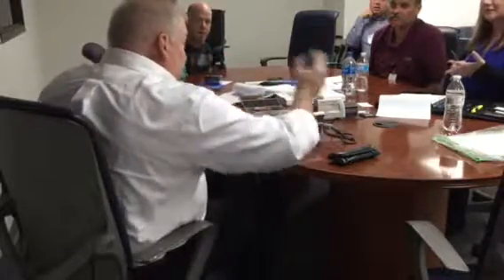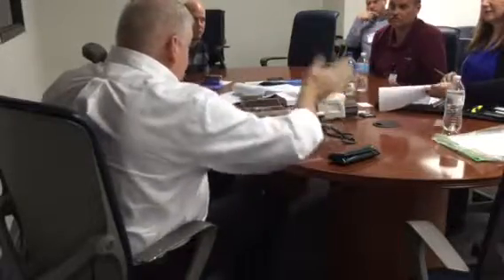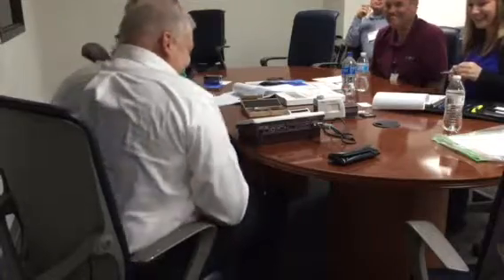So now we go home. Same data set, and I can't stress that enough. Once you start on the patch, don't move. We've established our repeatability, we've calibrated. Go ahead and hit start one more time. Stop moving, Angela.